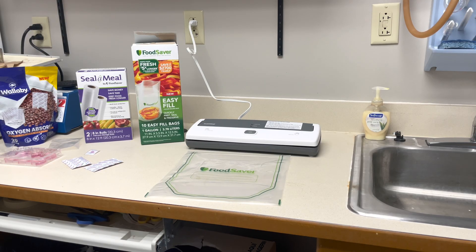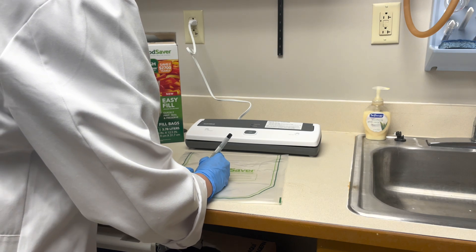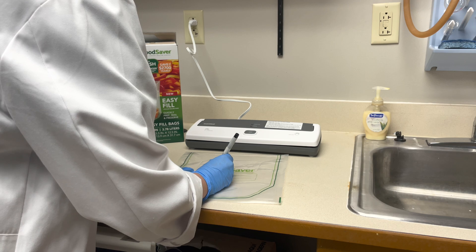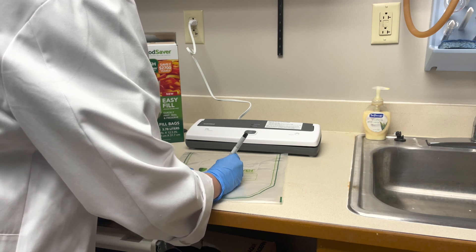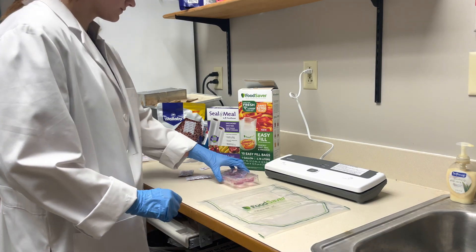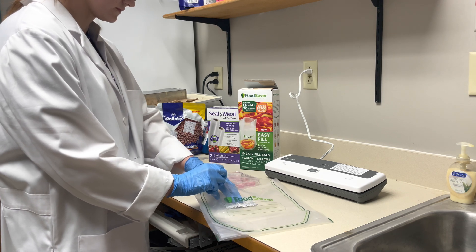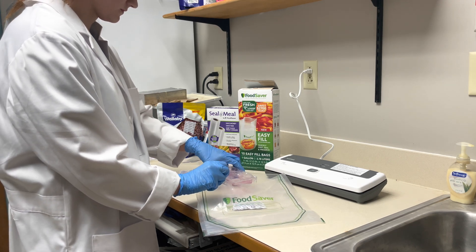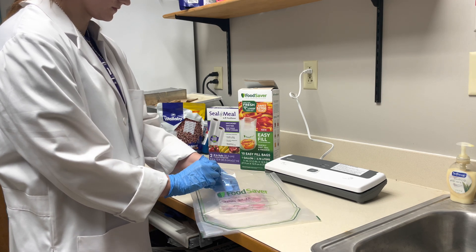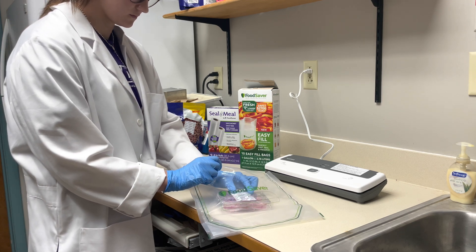Once your materials are gathered and you are ready to do the hypoxia treatment, grab your plate, flask, or whatever container your cells are in from the incubator. Here I am quickly labeling the vacuum bag with my name, the date, and the name of the test. This six-well plate I'm about to pack has my seeded cells and media that contains HEPES buffer additive. Carefully place the cells inside a vacuum packer bag with the oxygen absorbers and oxygen indicators. I placed one oxygen absorber on the bottom, then my plate, then another oxygen absorber on top, and lastly an oxygen indicator dot.